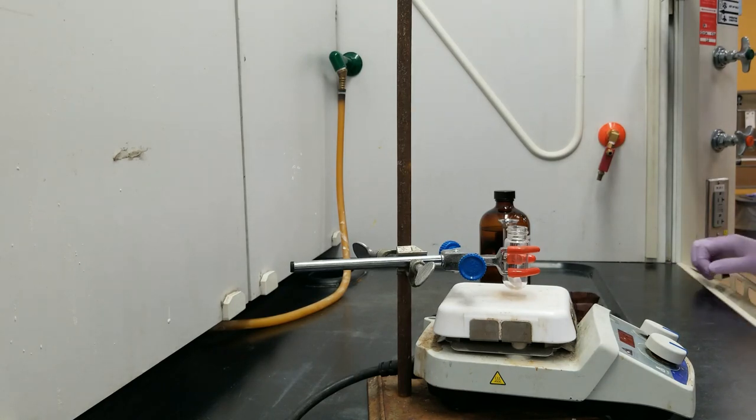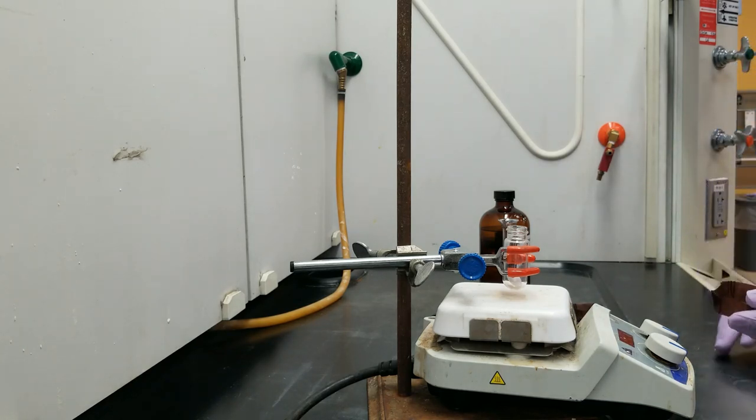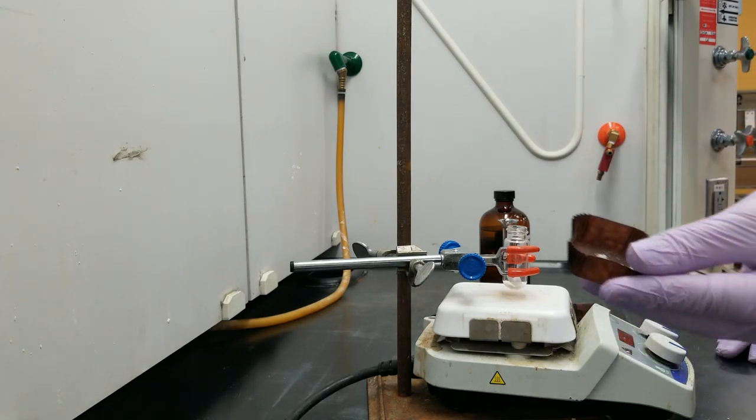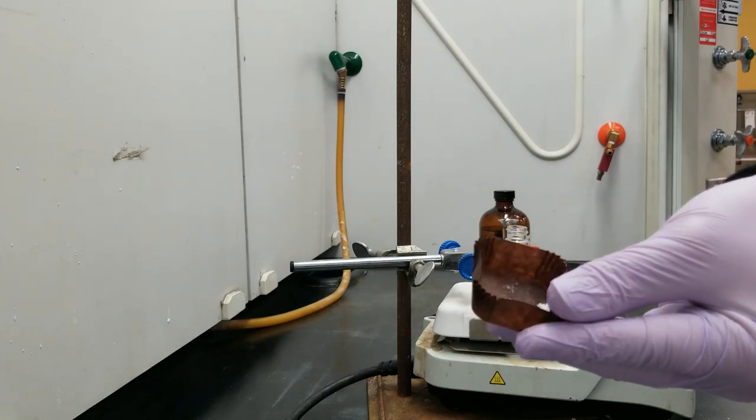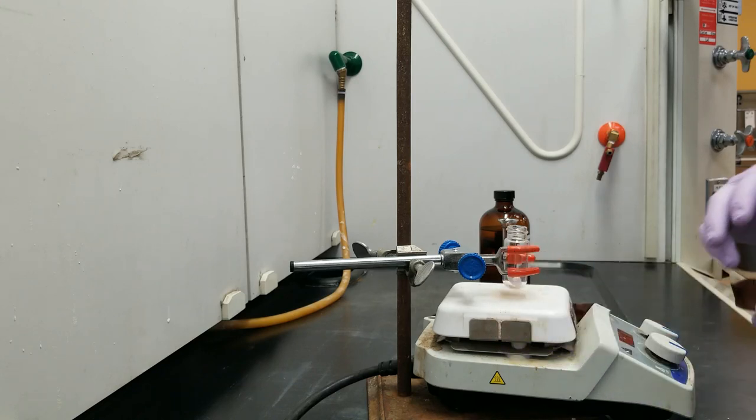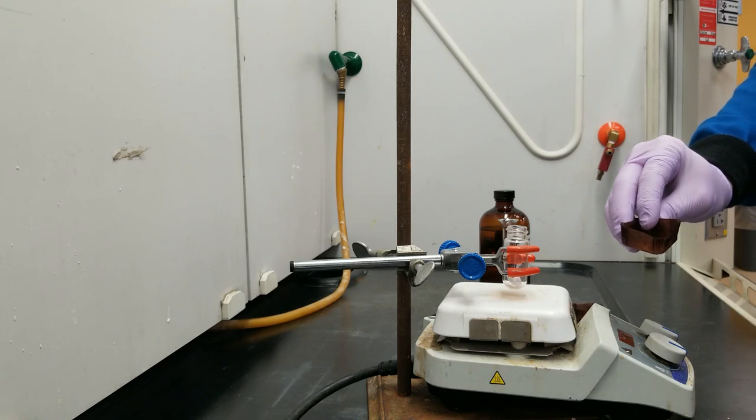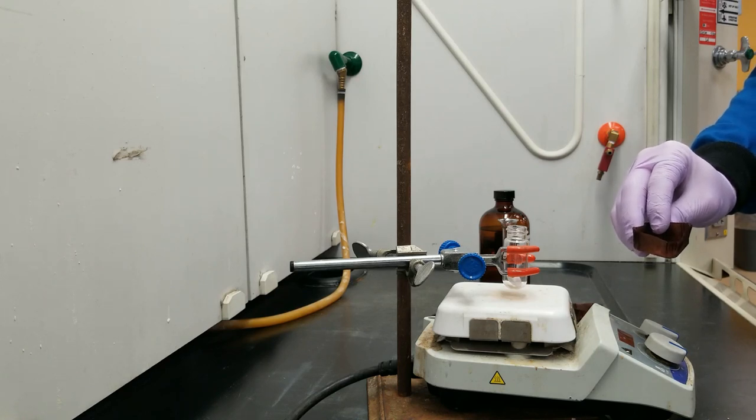All right. Hello, everyone. My name is Hayden Winter. I'm one of the TAs of the O-Chem Labs here, and I'm going to be walking you through the oxidation of the borneol experiment. Getting right down to business, let me introduce you to borneol. This is a chunky, dry, white powder. You can see it's clumping up on itself because it's rather fine. And this is what we will be oxidizing. This has an alcohol group, which we will be turning into a ketone group.